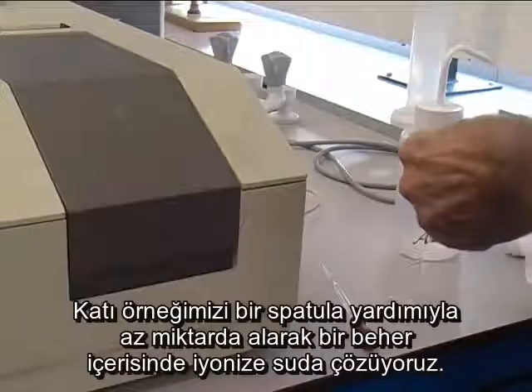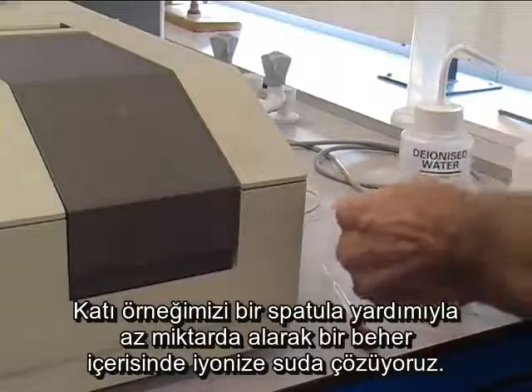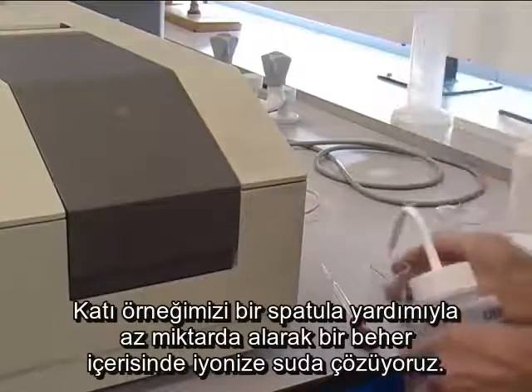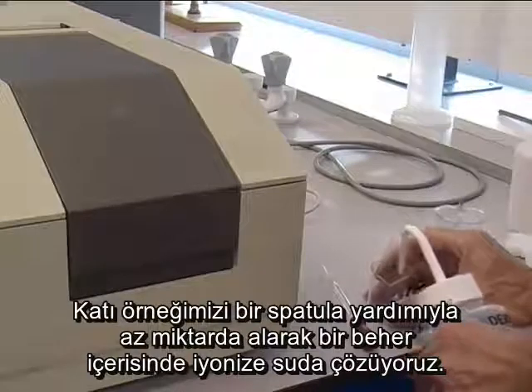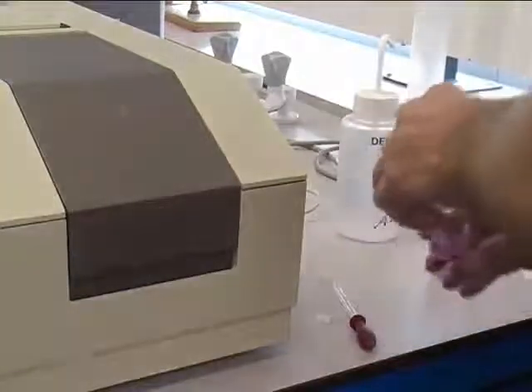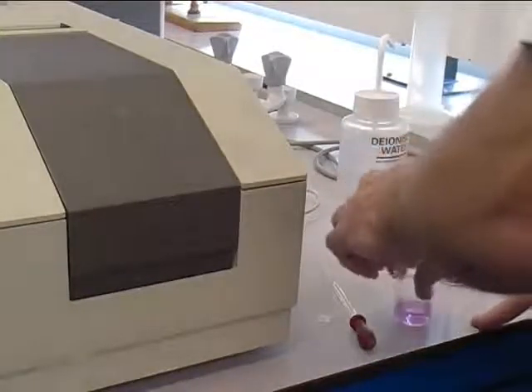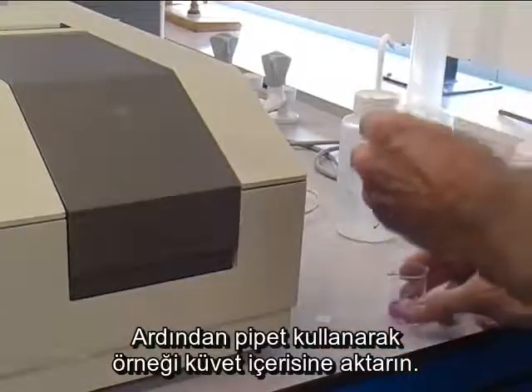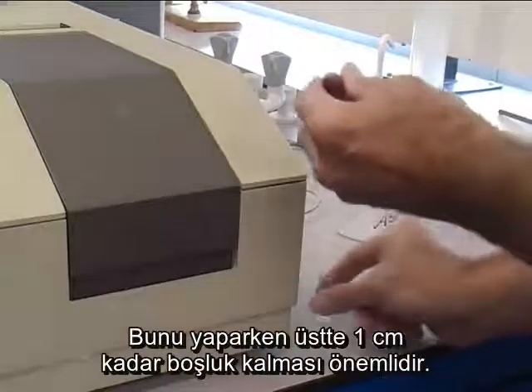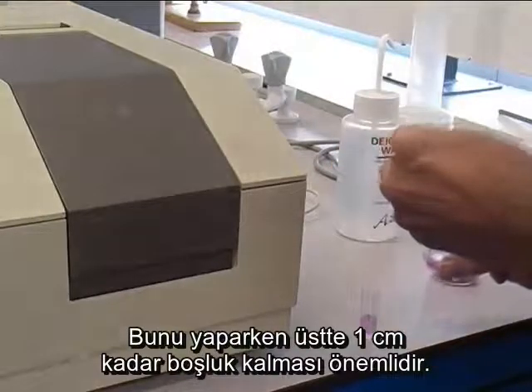To run your sample, take a small part of your sample, typically the end of a spatula, place into a beaker and dissolve in deionized water. Then, using a pipette, transfer your sample into the cuvette, leaving about 1 centimetre until the top. It is important not to overfill it.